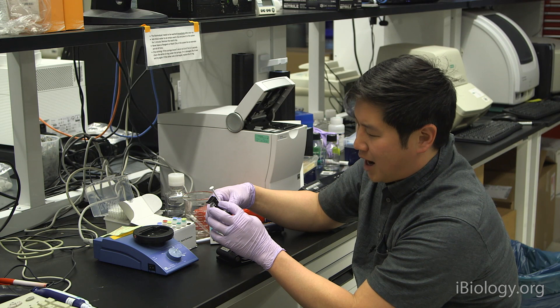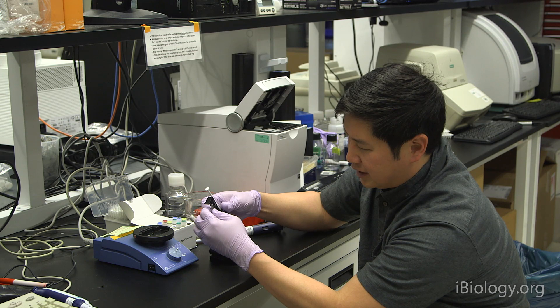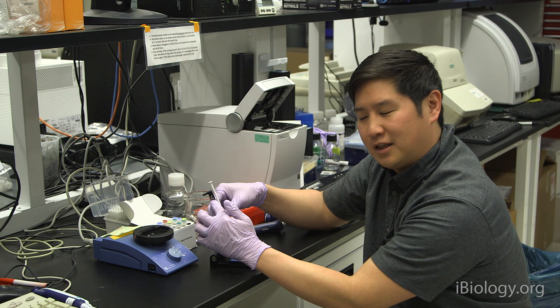There's a top, middle, and bottom setting. For the high-sensitivity DNA chips, we'll have to use this lower setting. You just move the silver handle down until you get it to this lower location and make sure it catches into the hold.